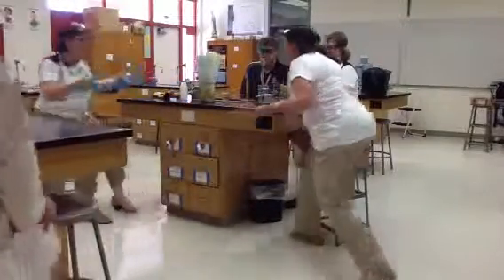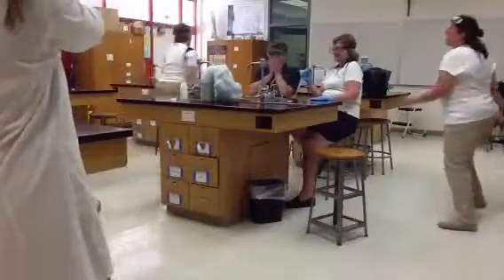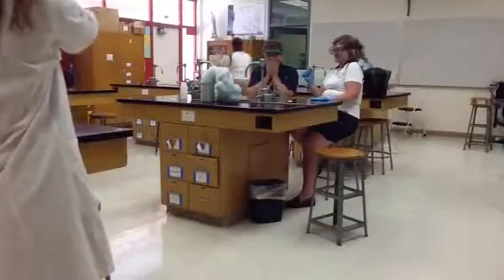Terry! Terry! Terry Renee! Get out of the classroom! Oh! Pray the Hail Mary. Ten times. Go!